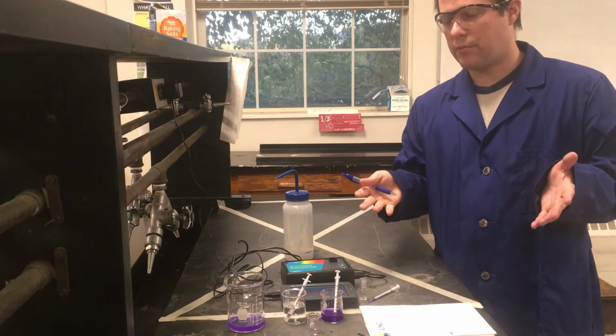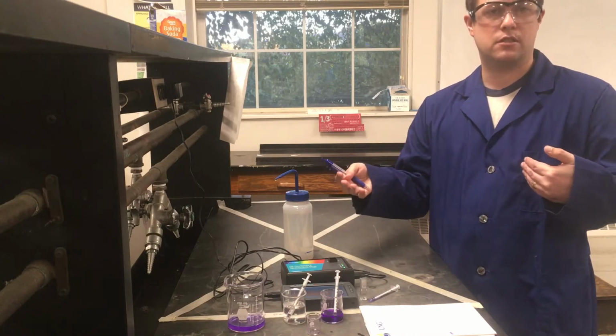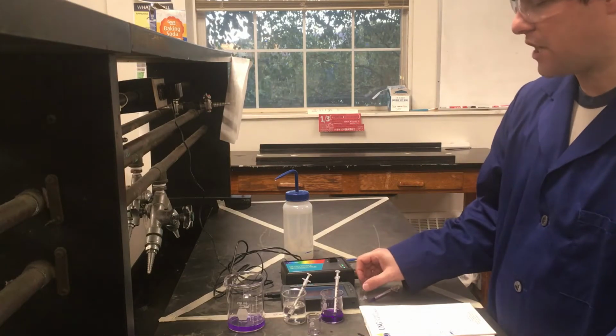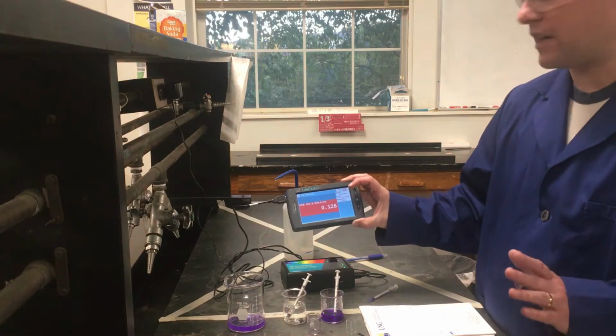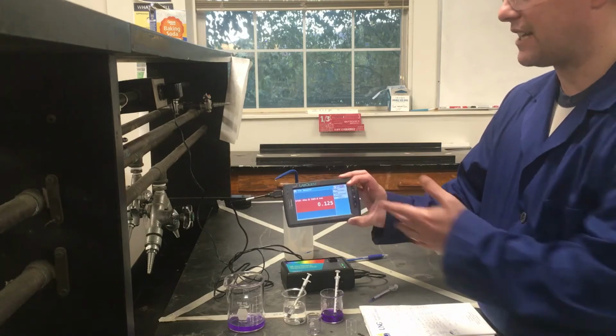All right, so for the second part of this experiment, what we're going to be doing is making just a bunch of different concentrations and basically just measuring their absorbance. So I have made one change to the LabQuest settings, which the camera may be able to see from here decently or not. I'm not 100% sure on the glares. But if I'm looking at this, it's telling me now it's actually giving me an absorbance reading.